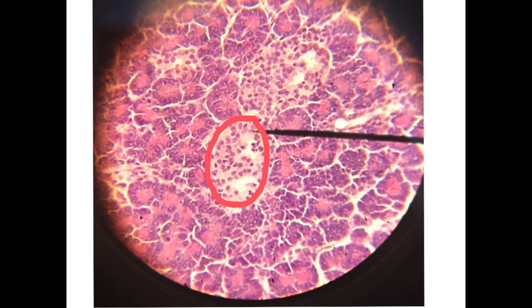And actually, sometimes you have also a very narrow white space surrounding this clump of cells, and you may say that it is the renal corpuscle. No, look at the surrounding tissue. Here at the surrounding tissue, we have the acini, and the acini do not show actually an evident lumen in the section like that of the Malpighian renal corpuscle surrounded by the renal tubules with the lumen.